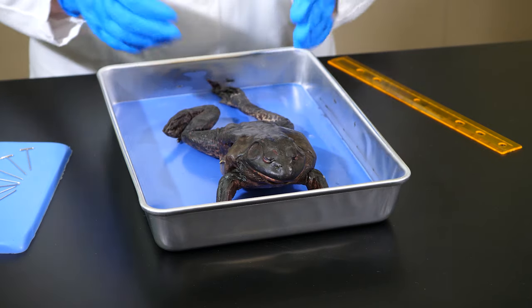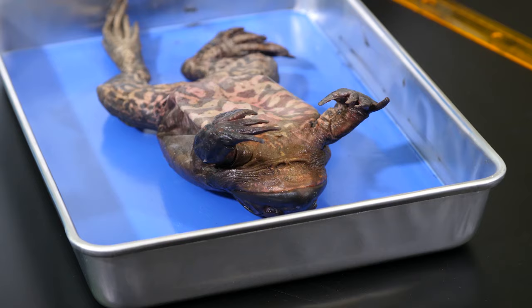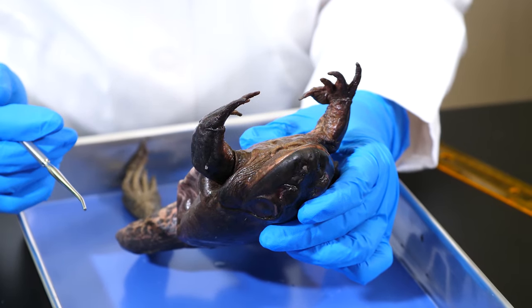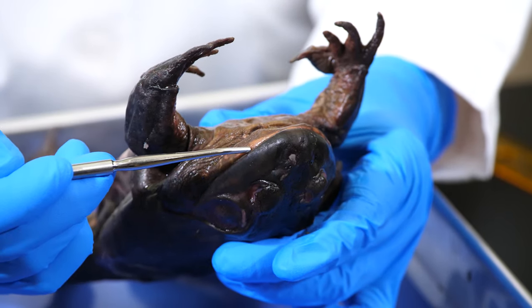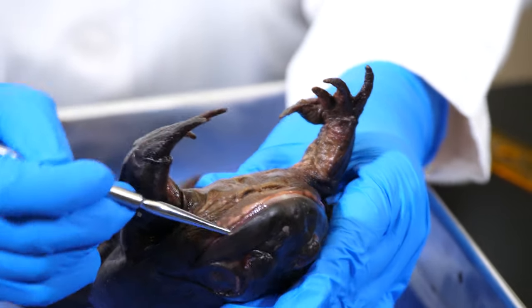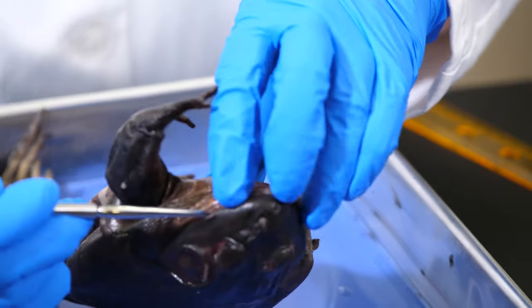Now let's flip the frog over and look at some of the structures inside its mouth. Once a frog specimen has been prepared, its jaws become set, so we need to pry its mouth open to look at the structures inside. We will use a blunt probe to force the mouth open wide enough to insert a finger, and then pull back on the mouth to hold it open just a little.